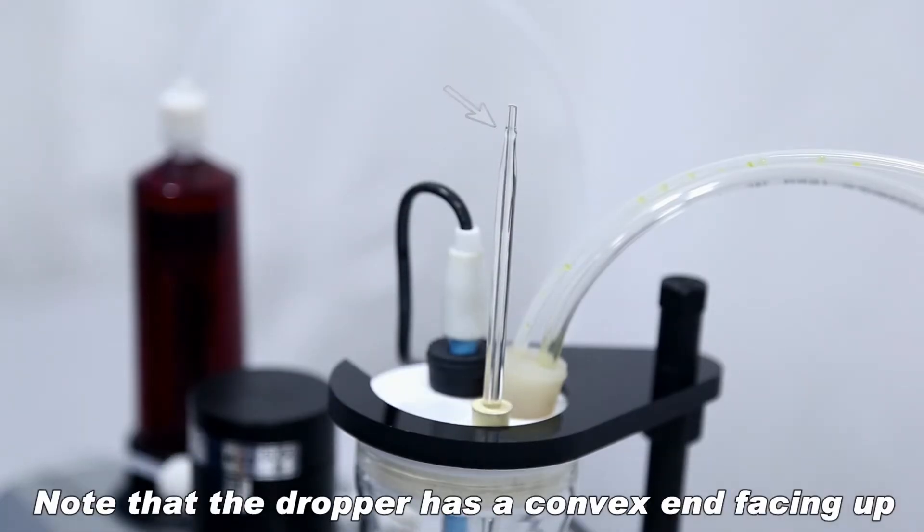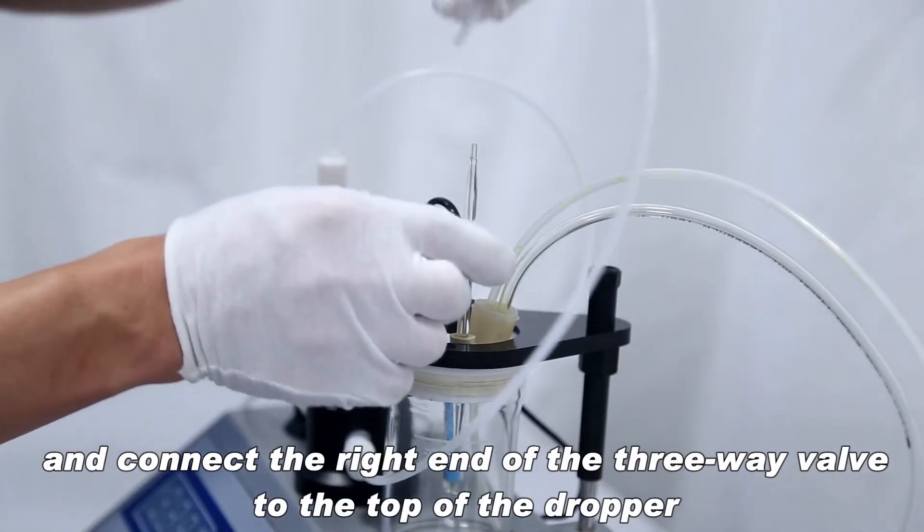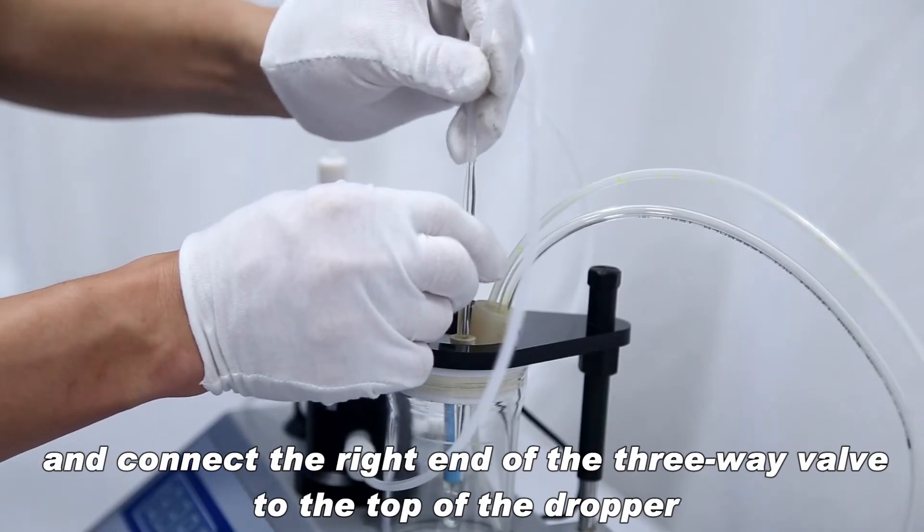Note that the dropper has a convex end facing up and connect the right end of the three-way valve to the top of the dropper.